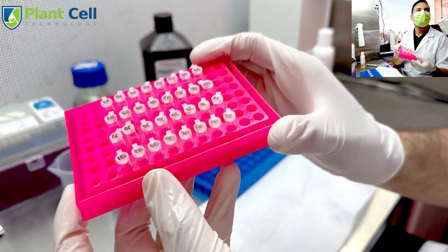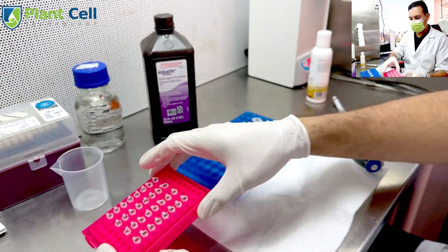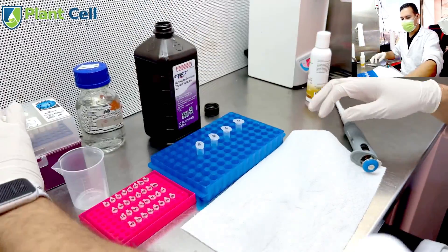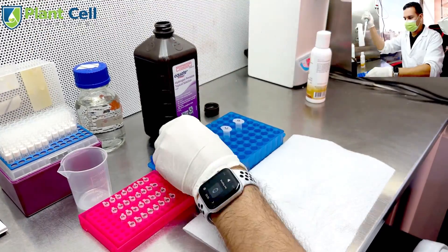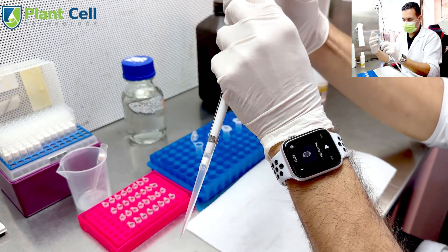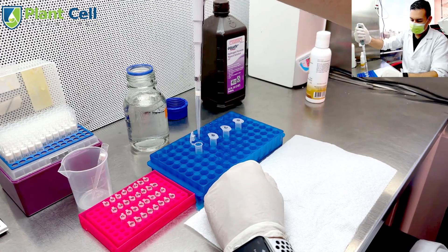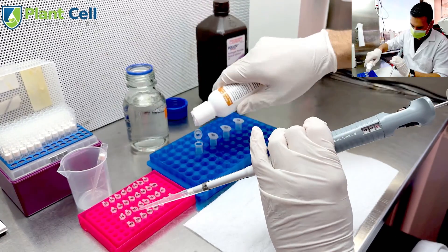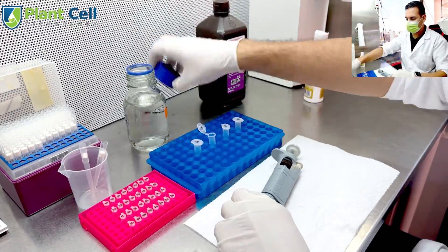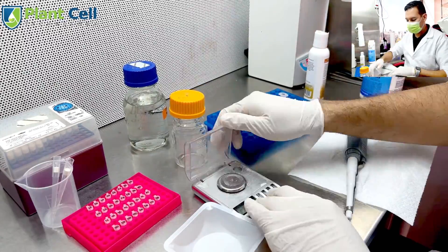I have to run an experiment, so I placed one seed into each of these test tubes, labeled A, B, C, and D. Each will use a different sterilizing solution. The first one is hydrogen peroxide — I take one part hydrogen peroxide and nine parts water. I also add one drop of Polysorbate 20 as a surfactant, so the seeds have better contact with the sterilizing solution.